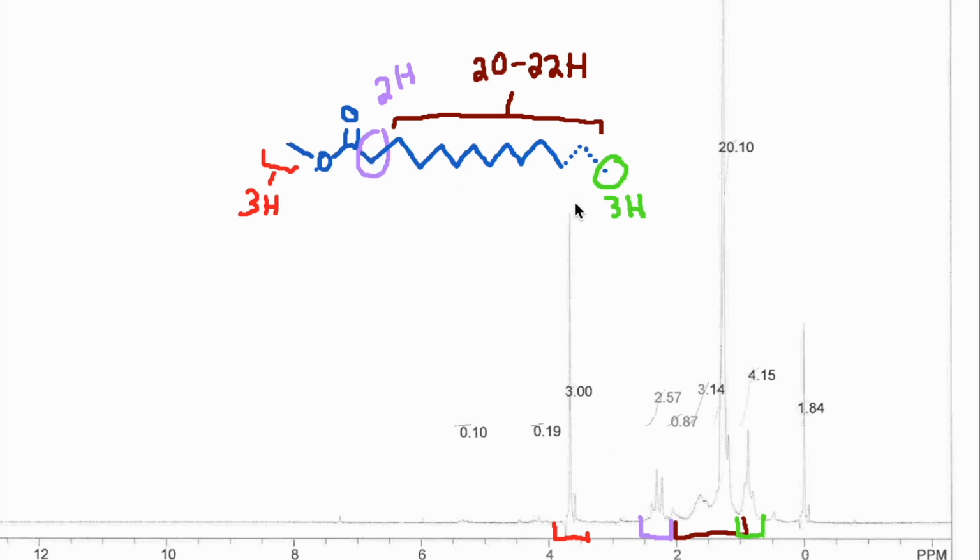And then in comparison, the rest of the molecule, most of biodiesel has about 12 to 14 carbon saturated fatty acids. So there's not that strong a signal in the alkene region. You can see that here. There's a little something integrating for about 0.1, nowhere near the 2 hydrogens that it would have if it had an alkene in it.